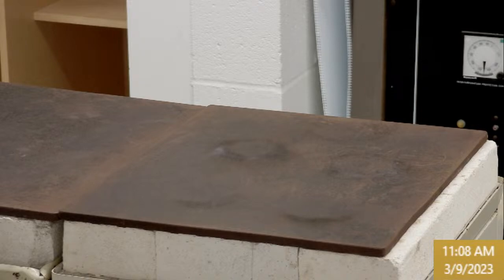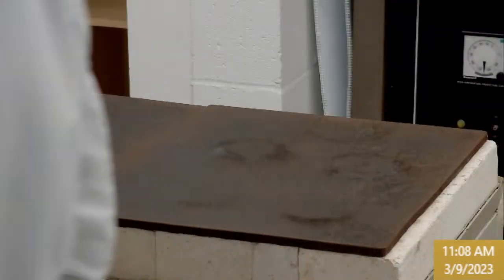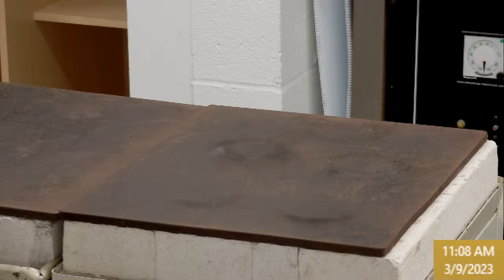And so now, for glass, commercial glass, you have annealed glass. So the stress has already been relieved from these. So when you put this under the polarizer, it doesn't show much.